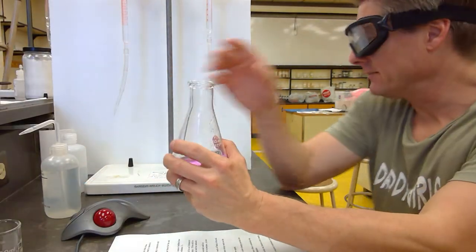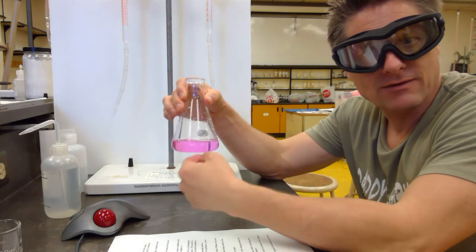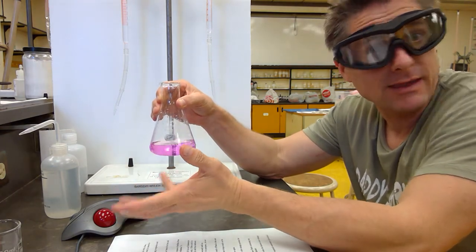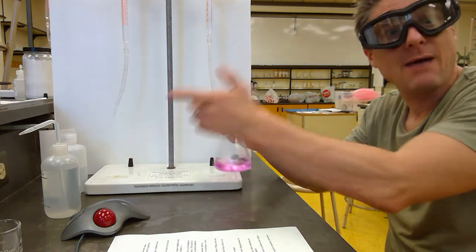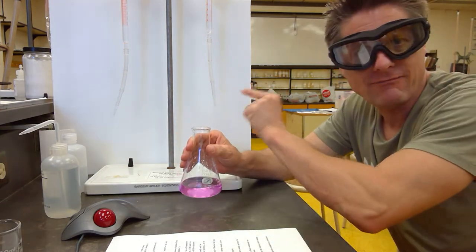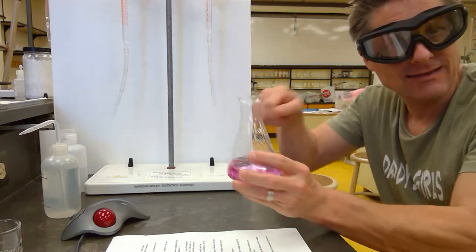So what we're going to be doing is I'm going to come over to my back titrant now. And I'm going to add that just at a quick drop rate until this turns colorless. Then I know I've done one back titration. I'm probably within 3, 4, 5 drops of it. Then I'll add a drop at a time till it turns pink. Add one drop till it's colorless. Do a half drop. I try to get that endpoint, that color change, due to one half of a drop, where I just get that drop hanging off the end and I just tap it off on the inside and spray it down.